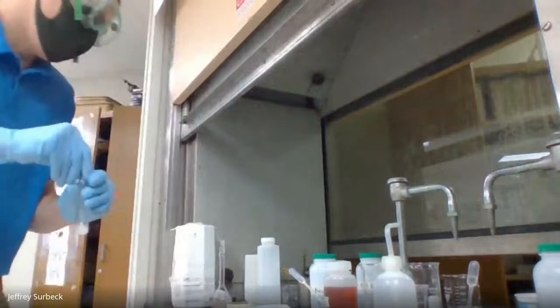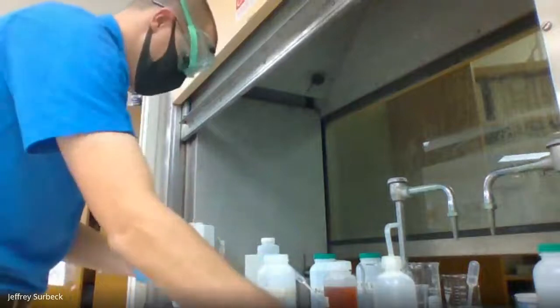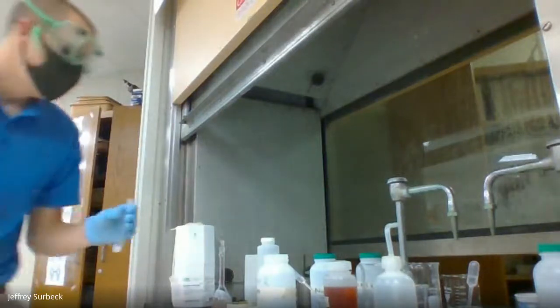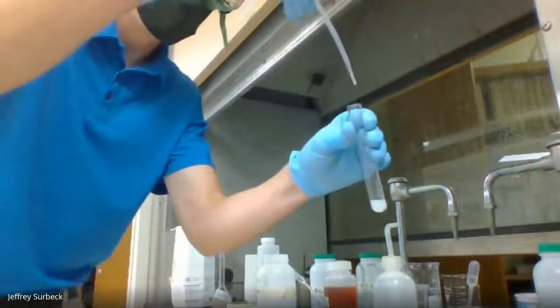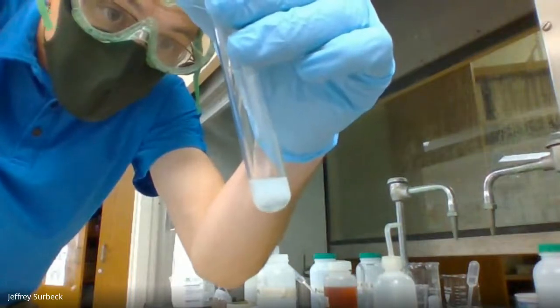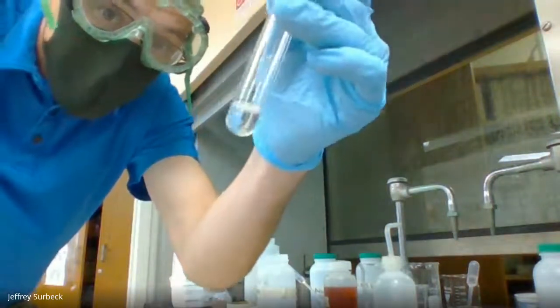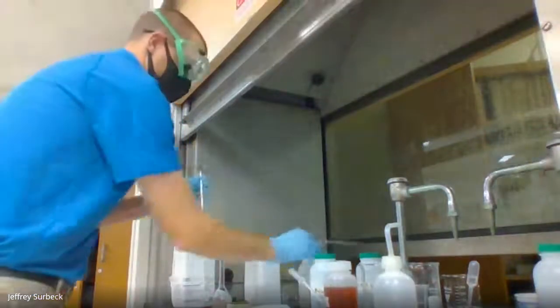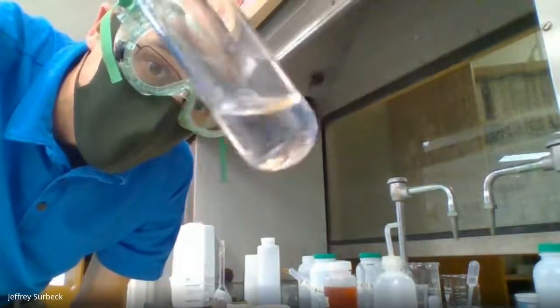Now what we're going to do, we're going to take some nitric acid, okay, 6 molar nitric acid, and we are going to add it drop by drop until we see a color change. Okay, so nitric acid. Again, I'm going to add it drop by drop by drop. Okay, now the white stuff that was on or in my test tube has now gone away. So we're back to that clear portion that we started with, okay?